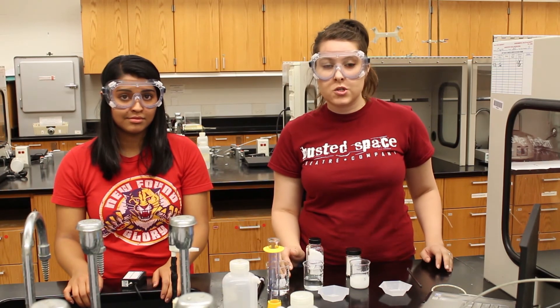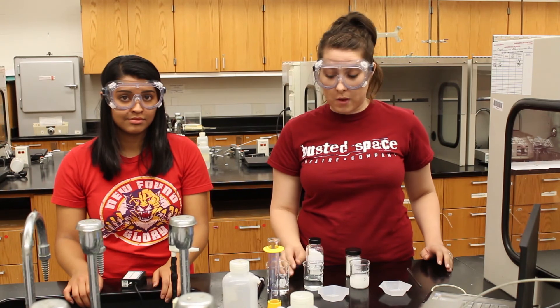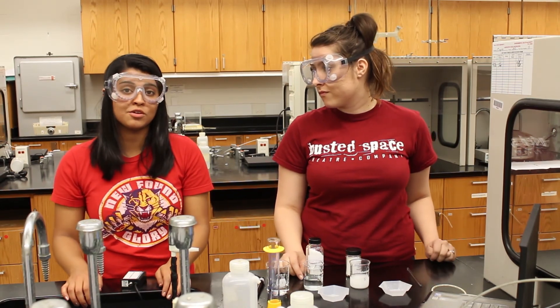Once you've finished all three parts of this experiment, be sure to wash all the glassware and the probe and return them to their proper locations. And because you've been dealing with chemicals, make sure you wash your hands before leaving the lab today. Good luck!